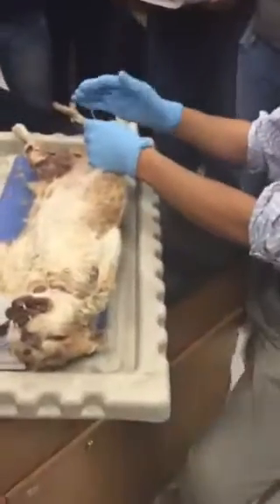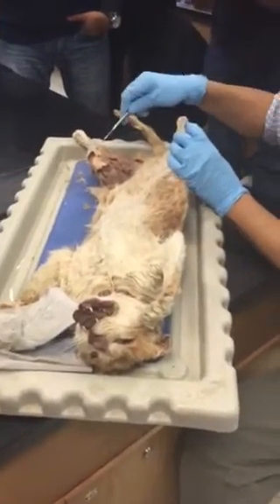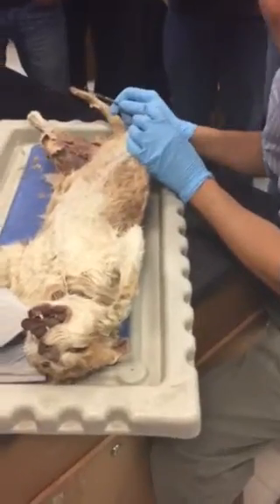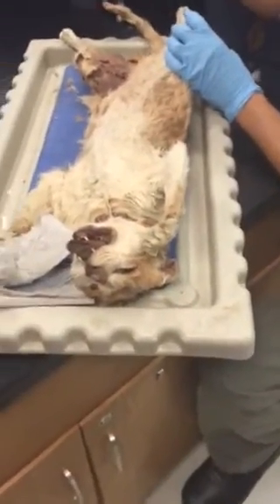But whether it's left or right, you should actually just use the terms medial or lateral, anterior or posterior, superficial or deeper. When you use these, it doesn't matter whether it's left or right. Otherwise you get confused. Which muscle is right? There's no right, whether it's lateral or medial, all right?